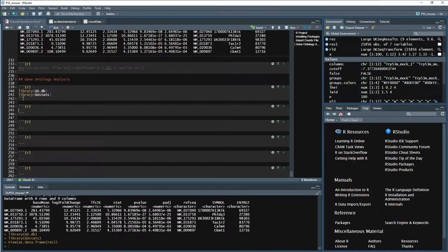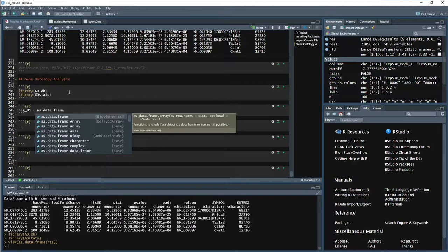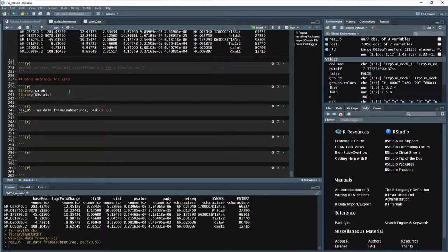So we need to subset that, and that's pretty easy to do. We can just do res05, meaning results with an adjusted p-value of 0.05, or we can do 0.1. And that's as data frame, like we did down here on the bottom, in order to view that results table. And then subset is a really nice function in R. We want to subset our results table, and we want to subset it by our p adjust column. And we want to make sure that we're getting everything that is less than 0.5. Go ahead and run that.